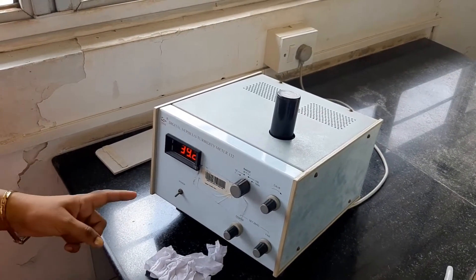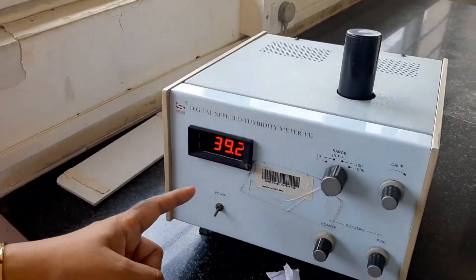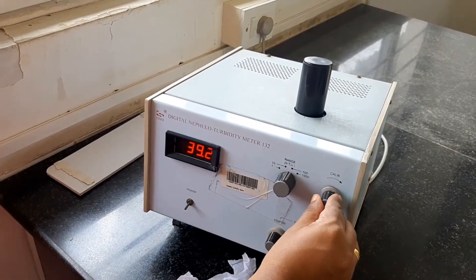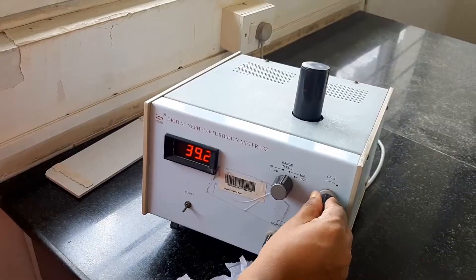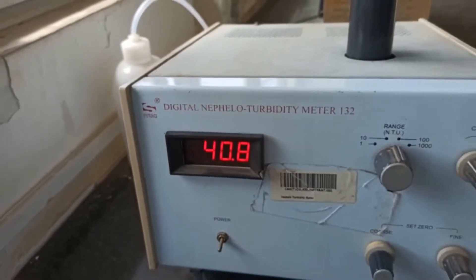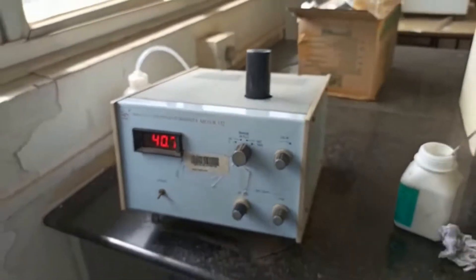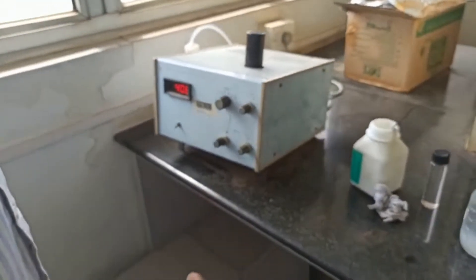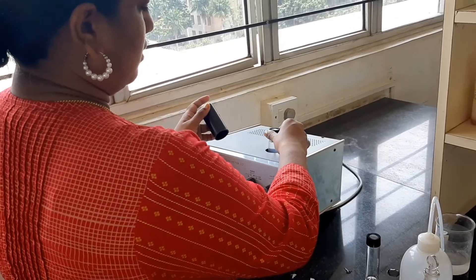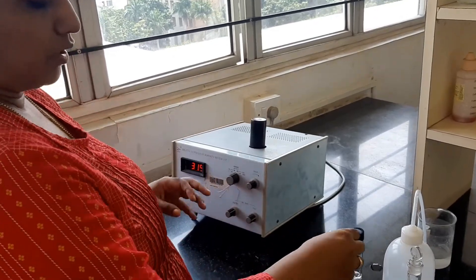So I am getting 39.2. I will be using this key to adjust it. Now I have calibrated it to 40. So I have set this to 40 and will now remove this sample. So I have calibrated the instrument.